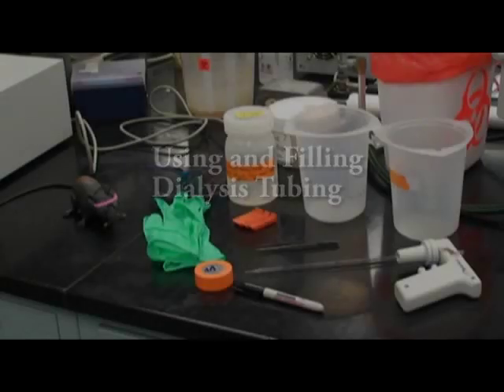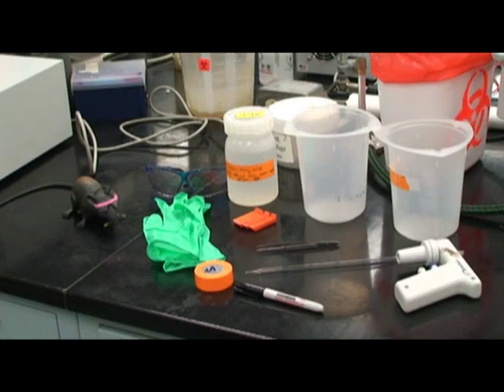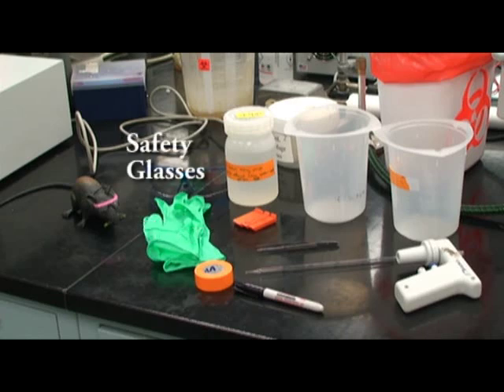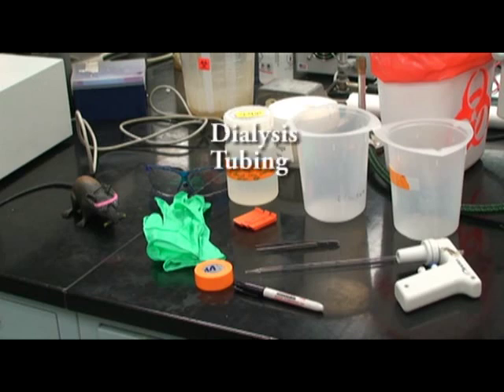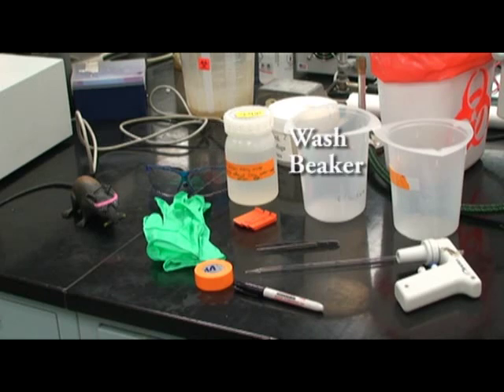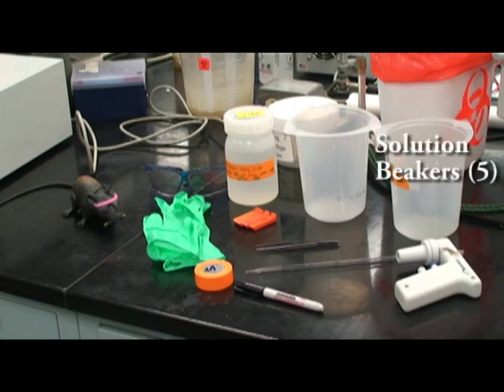Using and filling dialysis tubing. For this lab you will need gloves, safety glasses, dialysis tubing, a wash beaker, and solution beakers.